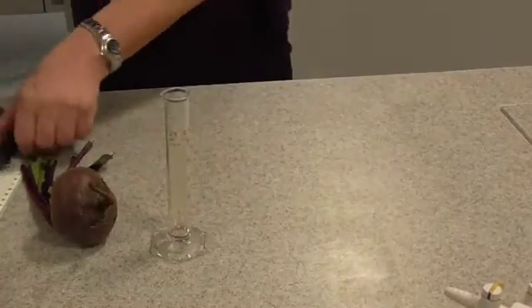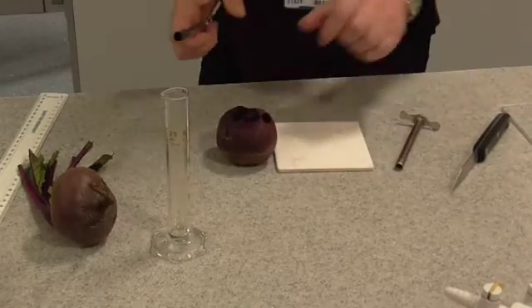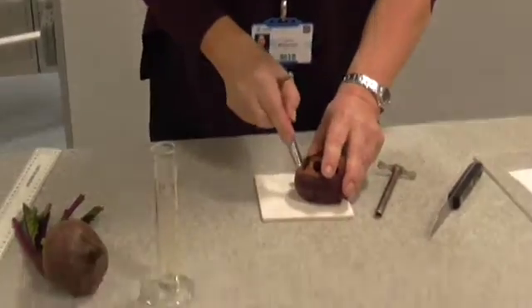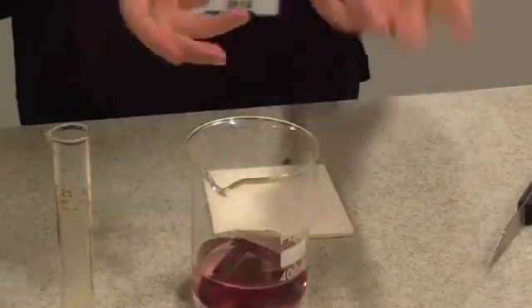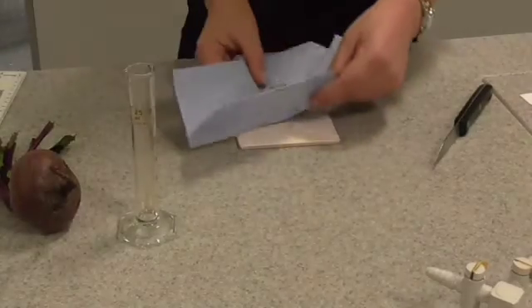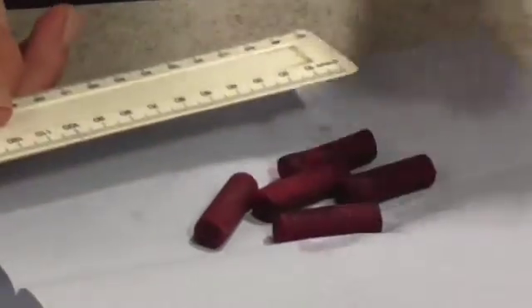Your next job is to use a cork borer — or you could use a chipper — to make yourself some evenly sized chips of beetroot tissue. Simply cut yourself some nice little cylinders of beetroot tissue. Give them a little rinse a few times in fresh tap water, just to remove any excess anthocyanin that's leaked out from the damaged cells. Then blot those dry, get yourself a ruler and a scalpel, and cut yourself five little chips of beetroot tissue, making them all the same length so they have as similar a surface area as possible.